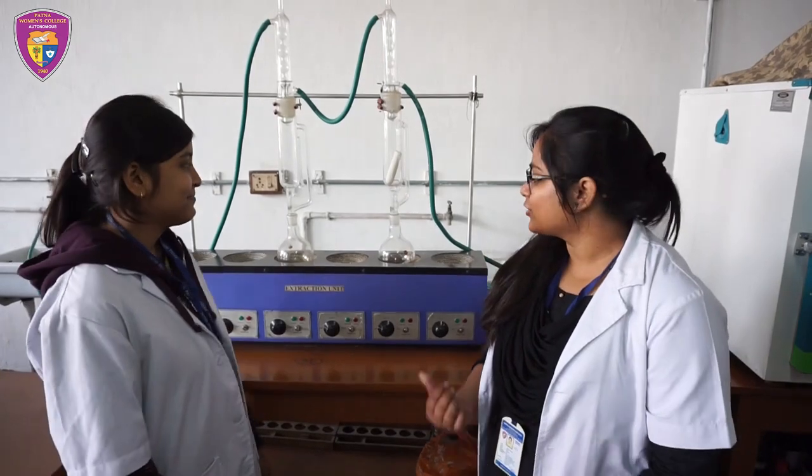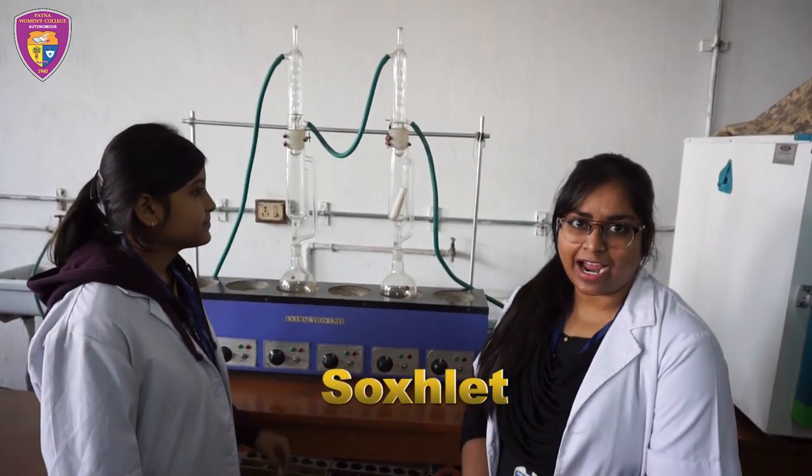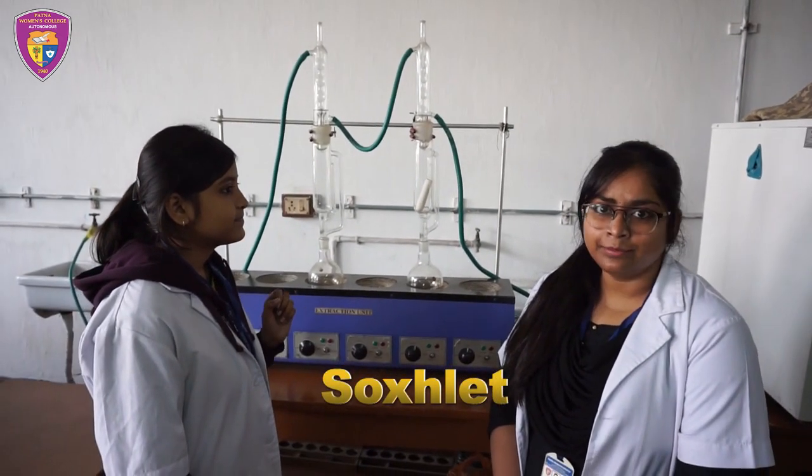Hello everyone. My name is Vadesha Srivastava and this video is a brief run-through of our biochemistry department laboratory in Patna Women's College, just to give you an idea of what the general setup and feel of a lab can look like. This is a Soxhlet extraction unit. We are extracting fat from capsicum.